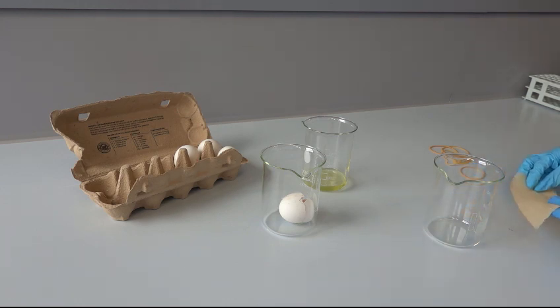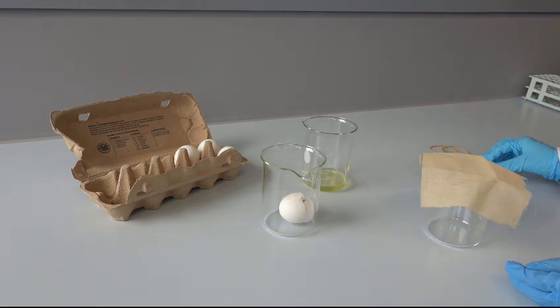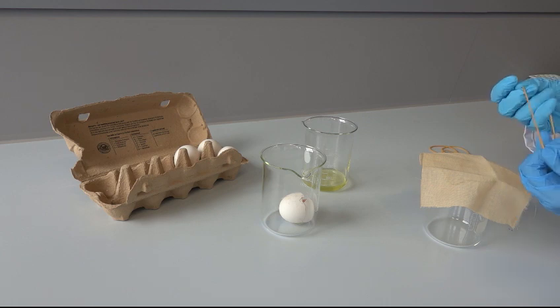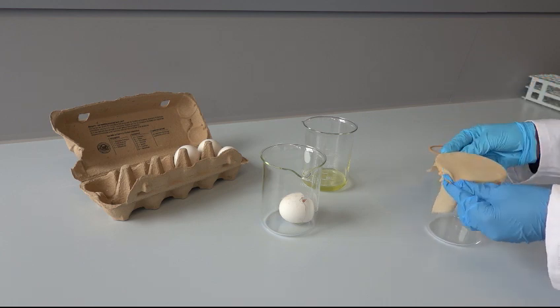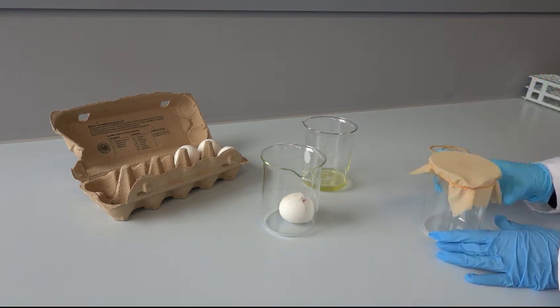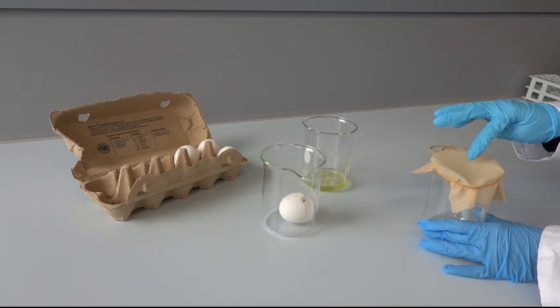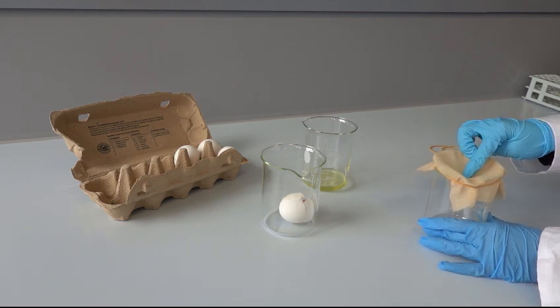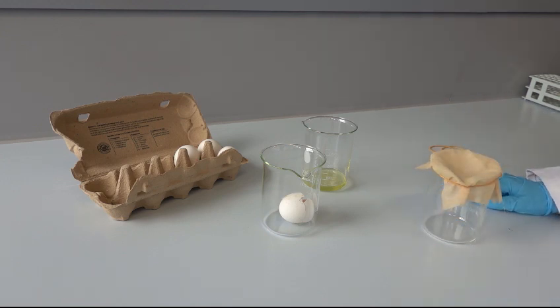Take a 250 ml beaker and place one piece of cheese cloth over the opening and fix it with a rubber band. Make a 5 cm deep hollow in the cheese cloth so the egg white will collect in the middle.